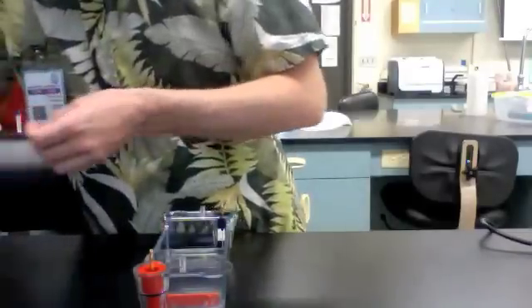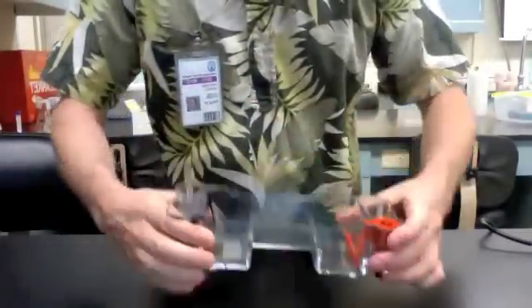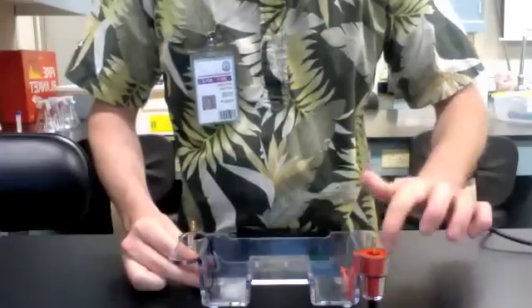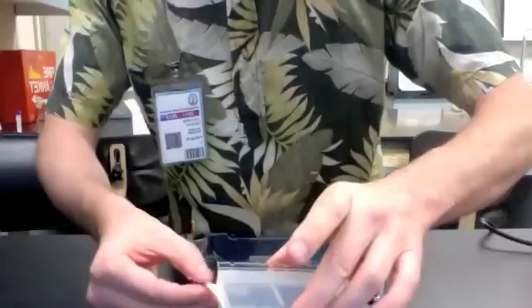This is the chamber you're going to load the gel into. Place the chamber down on the table—red is for positive, black is for negative. I'm going to carefully untape the gel, being very gentle so that I don't end up ruining anything that I've spent a long time setting up.